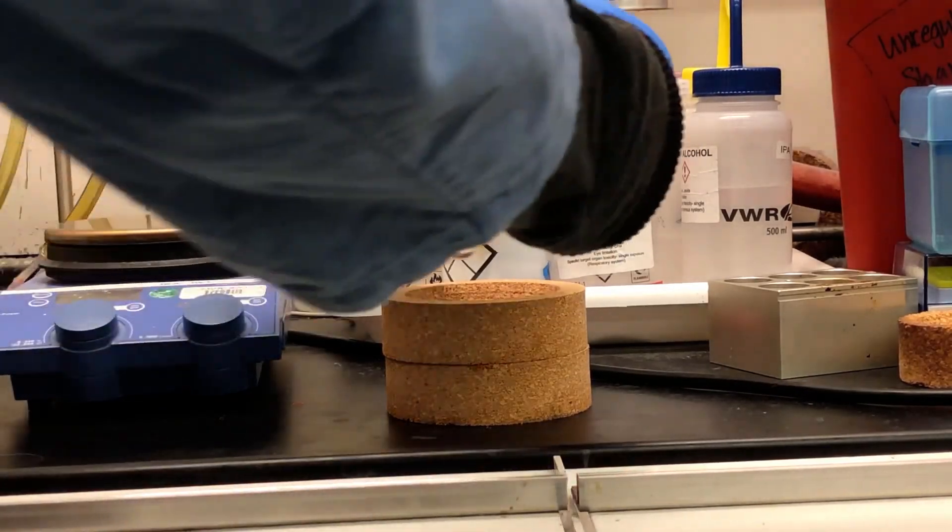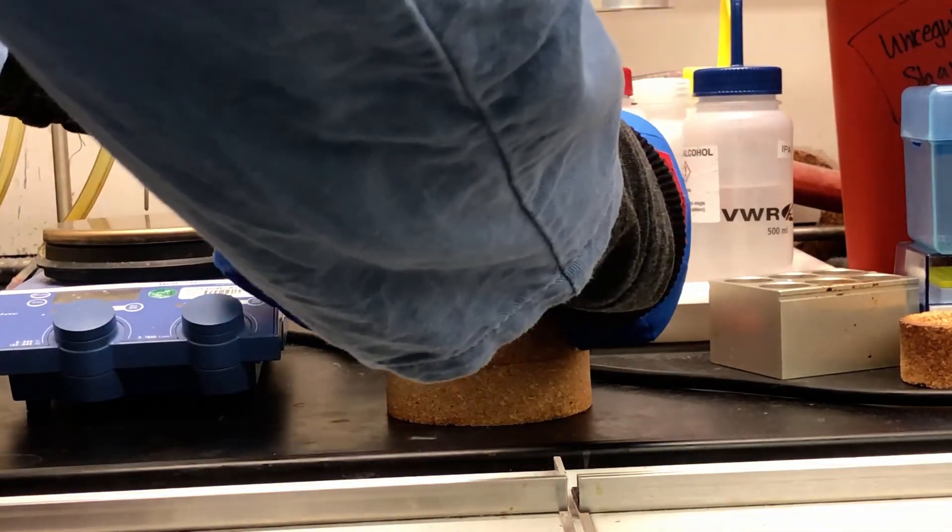When you're done with the Dewar flask holder, leave it in a nearby fume hood for ventilation as the liquid nitrogen evaporates away.